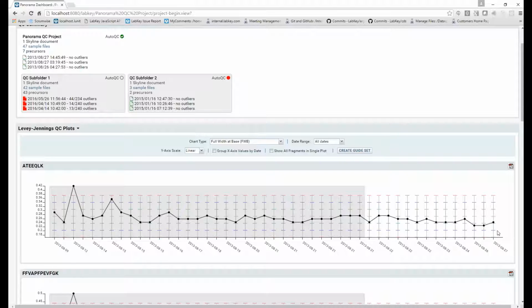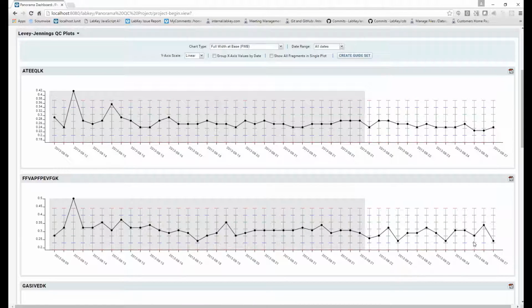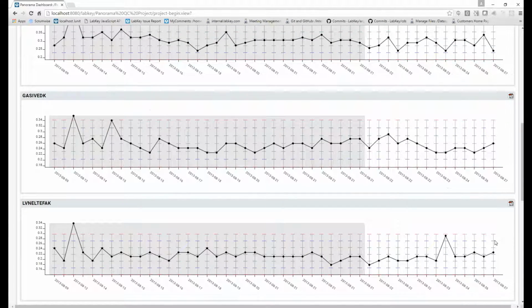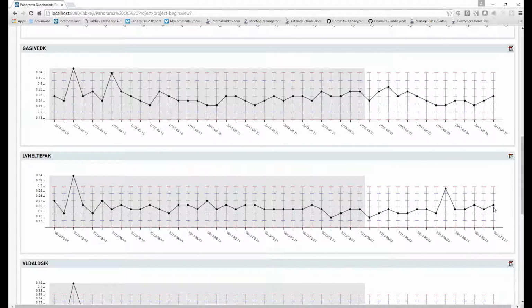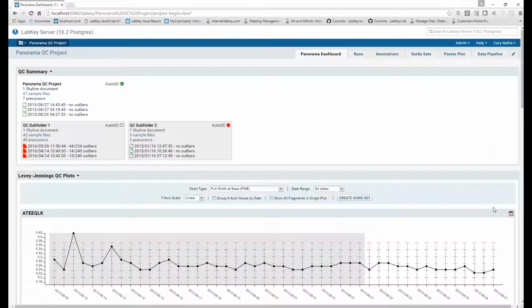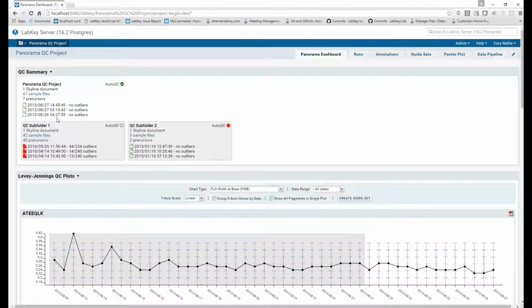The farthest 3 data points on the right here are the most recent 3 sample files for this given container, and those are the ones that we're going to show information for in the summary web part. As we scroll through, we can see that these last 3 data points for this particular metric fall within the expected range, but it would be tough to see at a glance how many of these sample files' values across the different metrics fall outside of the range or are outliers to that expected range. So that's what the QC summary tries to show up here with the 3 most recent sample files.